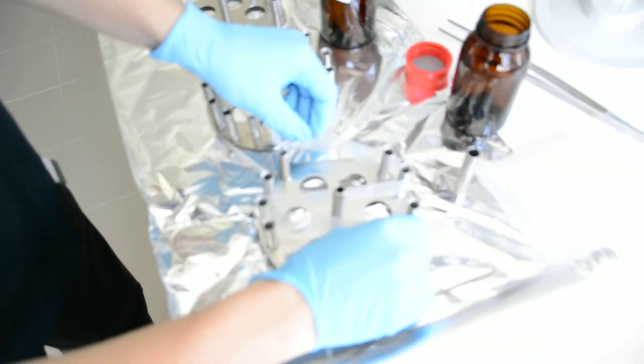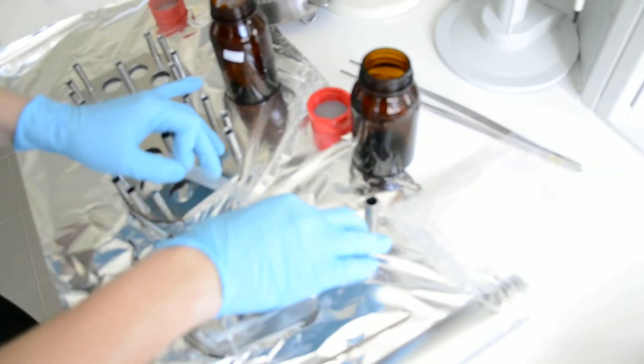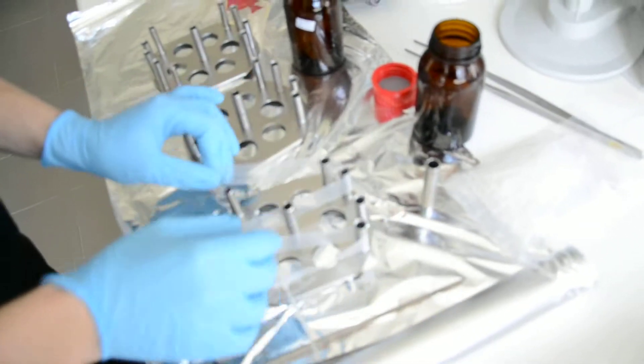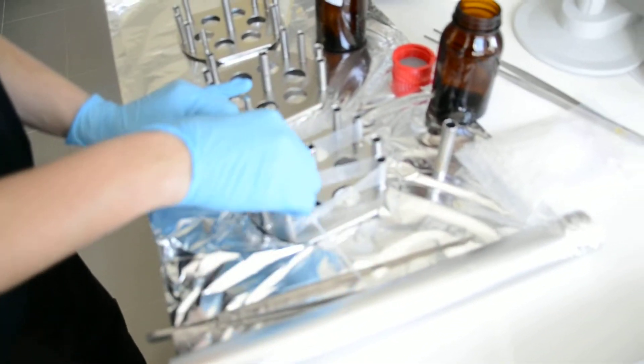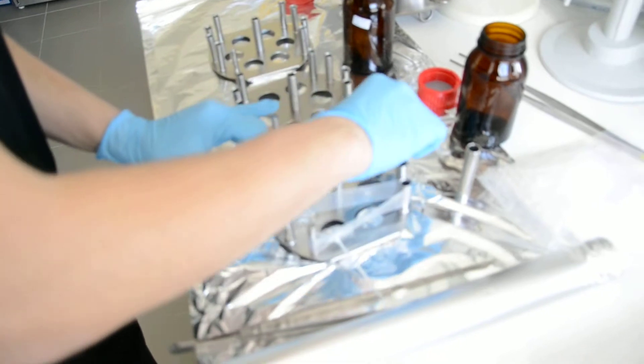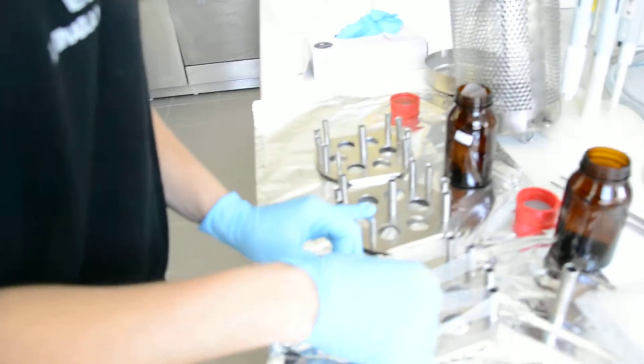Sometimes, this is, yeah, this is okay. We stretch it a bit. It's good to check that the stretch is everywhere the same.